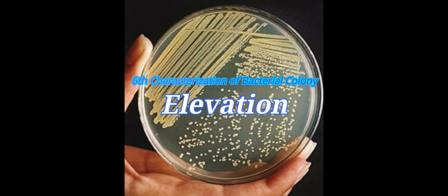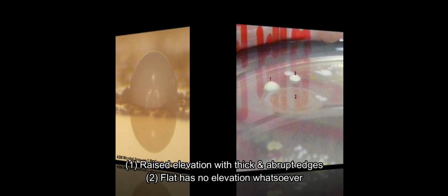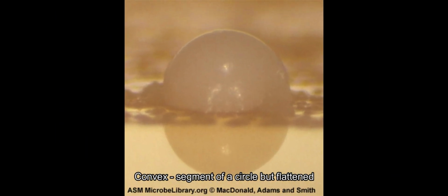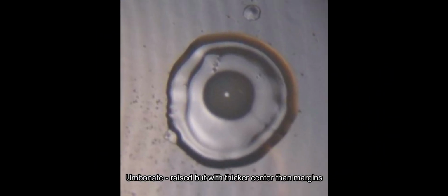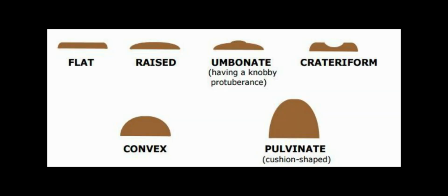The sixth characterization of bacterial colonies is called elevation. In the first picture, the area labeled with the number 1 is called a raised elevation, and it has thick and abrupt edges. The one labeled with number 2 has no elevation whatsoever and is called flat. Up next is the convex elevation, which has a segment of a circle but flattened. Essentially, it is shaped like a semicircle. Then the last elevation is the umbonate, which is raised but with a thicker center than margins. I have also included a number of other elevations not shown in pictures.